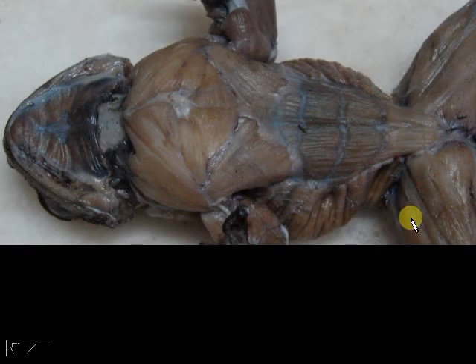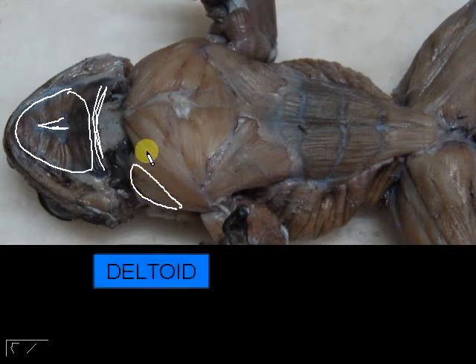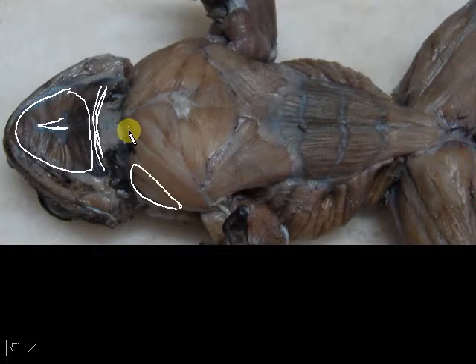Now let us look at the ventral view of your toad. Here let us look at the muscles. First, the triangular muscle, partly obscured. It is on top of the shoulder joint as described in your manuals. That is the deltoid. Next would be the muscle that runs from the pectoral girdle all the way to the humerus. So it's this part right there.